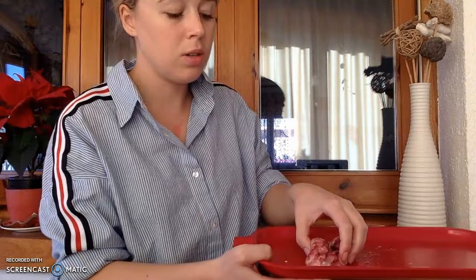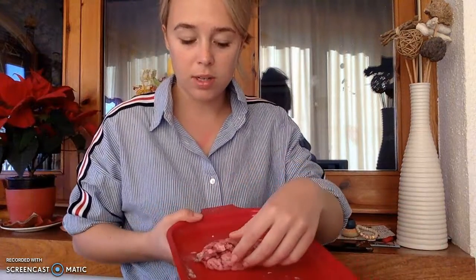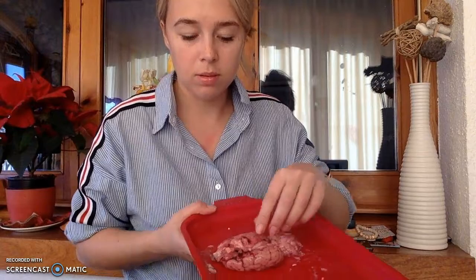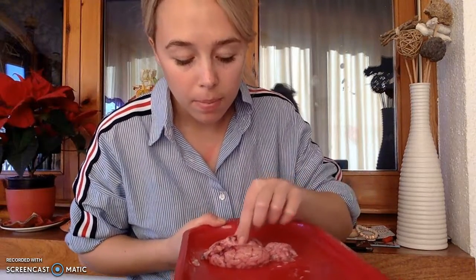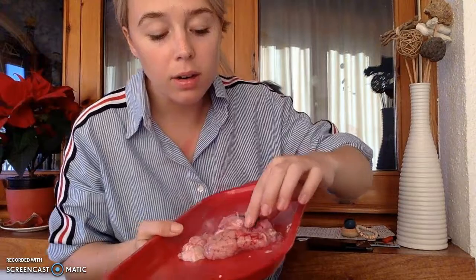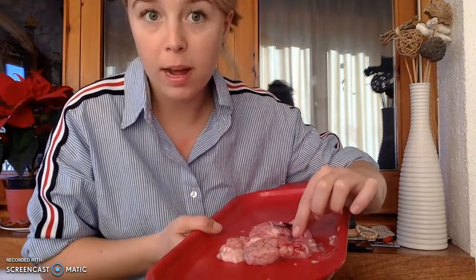Now, moving to talk about structures that are inside the brain. Gosh, what is the best way to do this? Yeah, this seems pretty good. Okay, yeah, but I liked this one better. Okay, so this is the front of the brain, the frontal lobe, and we're going to move our way backwards.